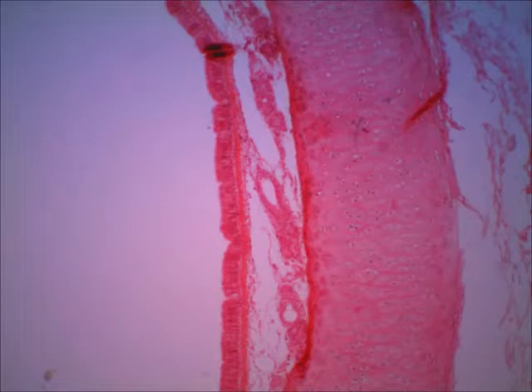Now in this third slide, we can see the same slide. Again, it's on a different view, and I've put it one power higher. So instead of scanning, this is on the low power objective, and you can see the cartilage very well. You might remember from A&P 1 that hyaline cartilage has lots of little cavities, as all cartilage does. Those cavities are called lacunae, and inside of the cavities would be the cells, which you'll notice here is just the nuclei of the cells on this lower view. But those cells are called chondrocytes.